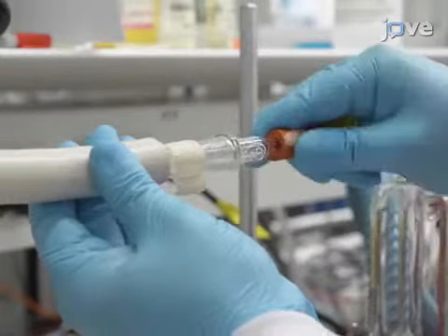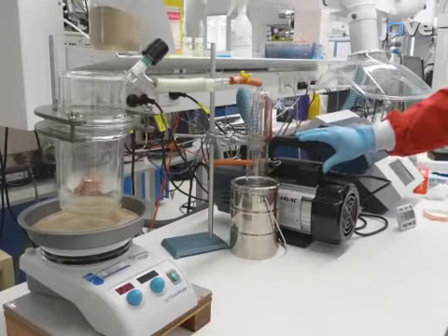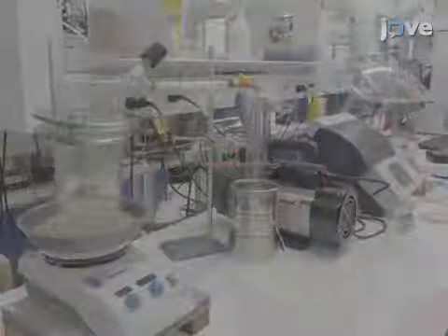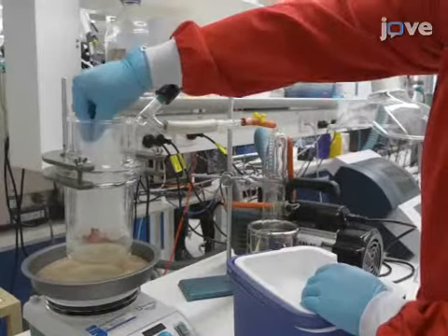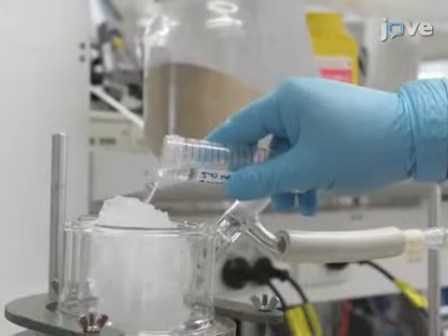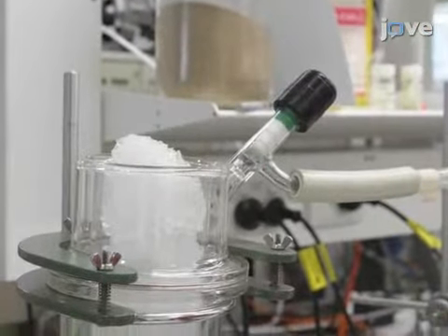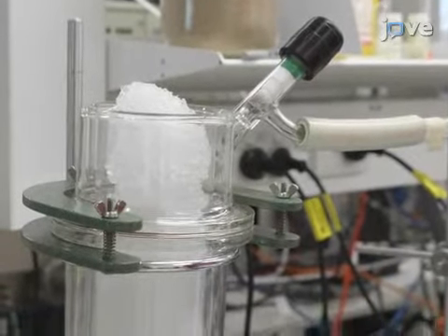Connect the chamber to the vacuum source, engage the vacuum, and allow it to stabilize down to approximately 25 millitorr for 5 minutes. Pack the cooling finger to the top with ice and add 50 milliliters of water. Allow the apparatus to settle for a further 5 minutes before proceeding.